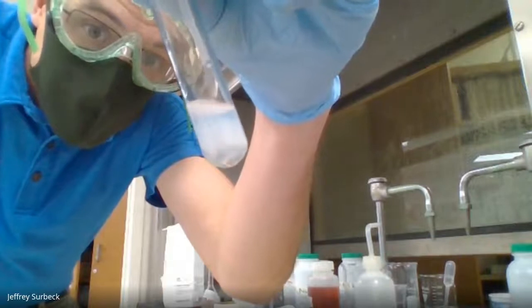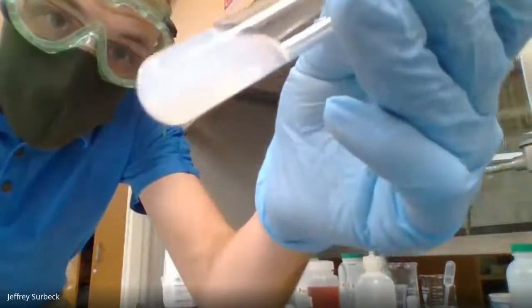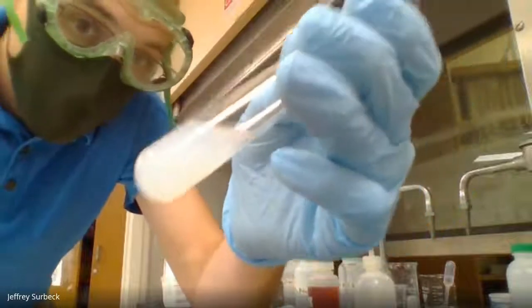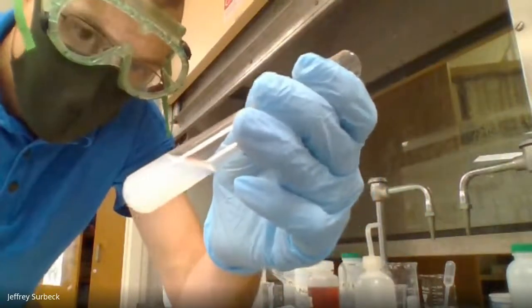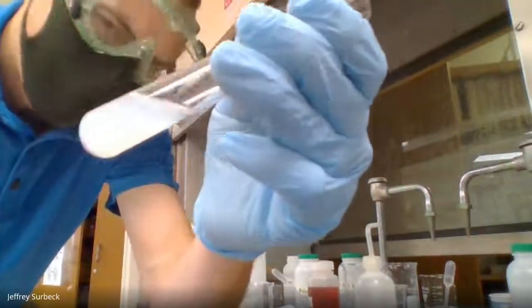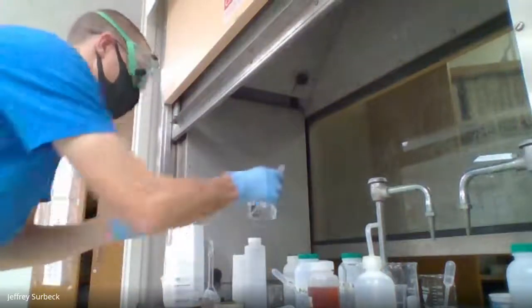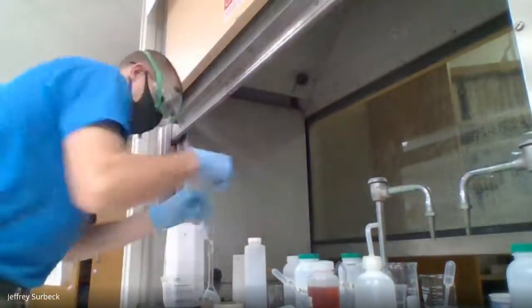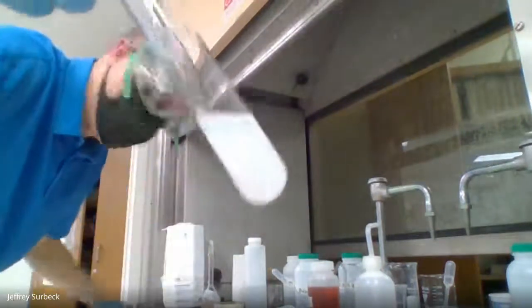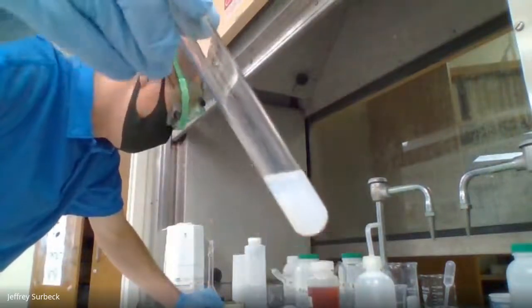All right, notice what's happening. Check that out. We went back to that milky white substance that we had before, but we added hydrochloric acid. So I want you to record your observations, what happened here as we added the contents of hydrochloric acid to this particular test tube. Again, here is what happened. Here's the end results that you should be recording in number 13.